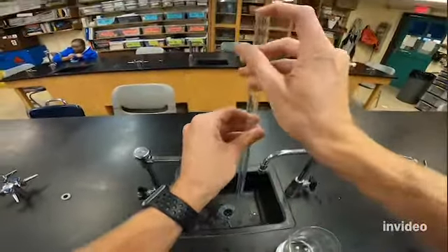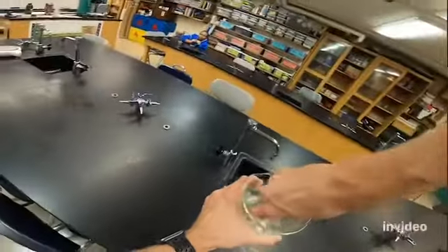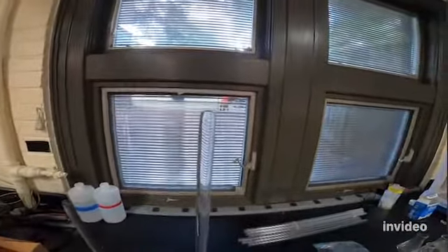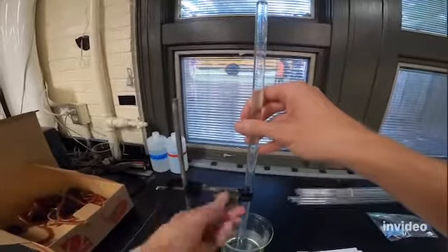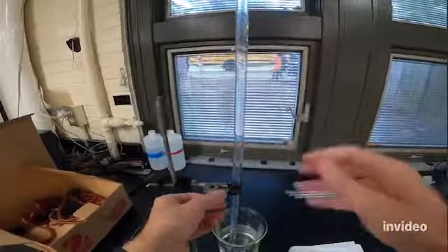All right, so it's completely filled to the top, and then I'm going to take my thumb or finger and put it over the top, and then I'm going to submerge it upside down in the water. And if I do it correctly, then I don't allow any air to get in. And so if you look at the top of my eudiometer, there are no bubbles, so it's completely full of water. I'm gonna bring that back over to my test tube clamp, and I'm gonna clamp that in. And that way, if you look down here, you can see that it's submerged in the water.